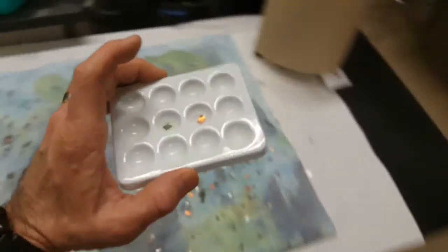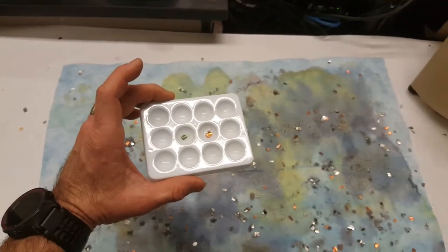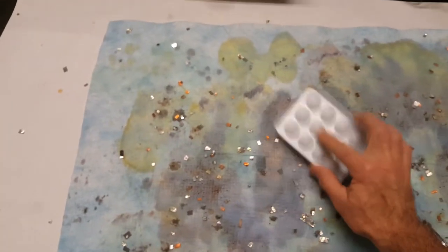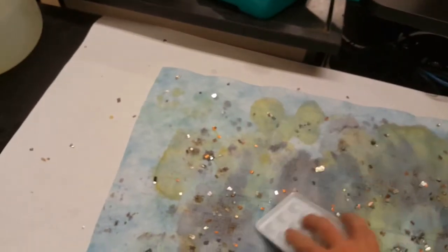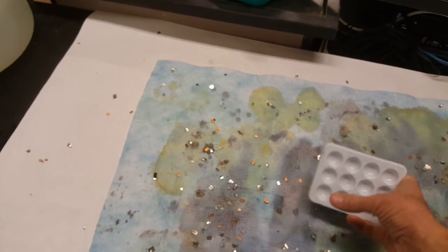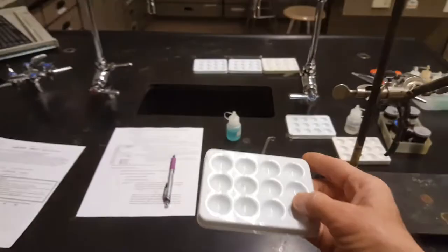For your cleanup today, just like our last lab, the metals versus nonmetals lab, you're going to come over here to the mat, flip your well plate over, and tap it out. If it doesn't come out, you can use your fingers. Just make sure you wash your hands afterwards. Then take your well plate over to the sink, wash it, use the paper towel to dry it, and replace it at your lab station for the next period.